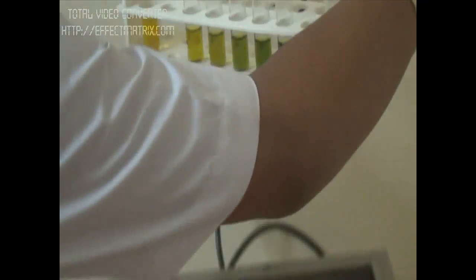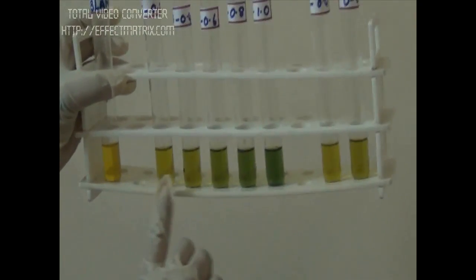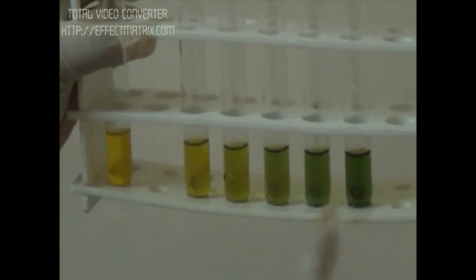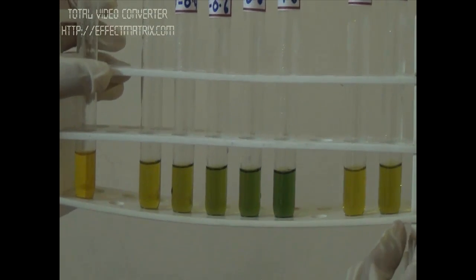Let's see whether the color is there or not. Here we can clearly see the color, the complex color. As the standard concentration increases, the color intensity has increased. And by comparing the standard with the unknown, we can now get the concentration of the unknown sample.